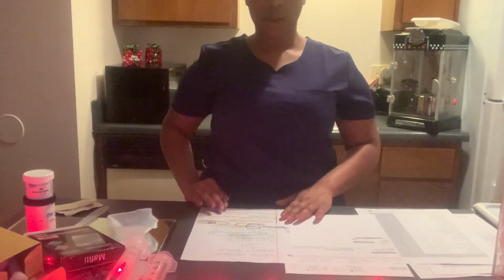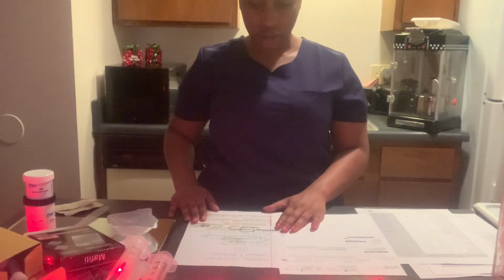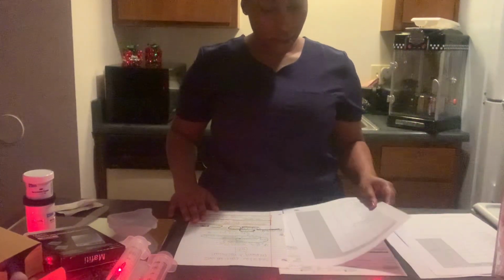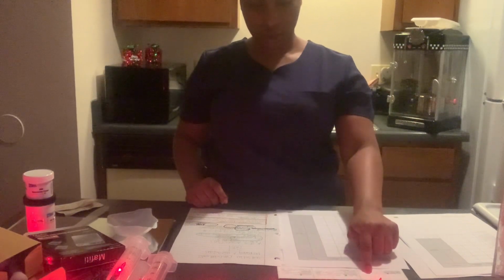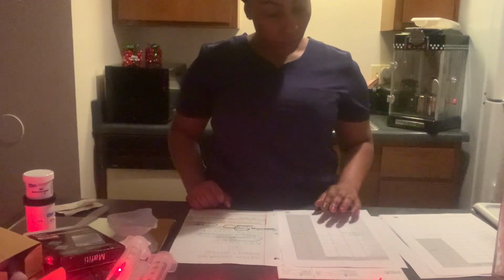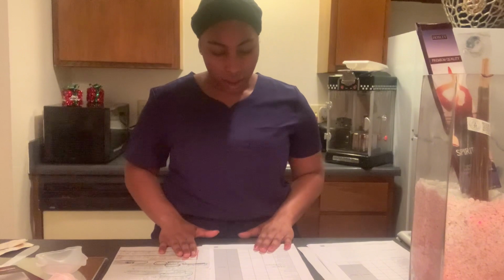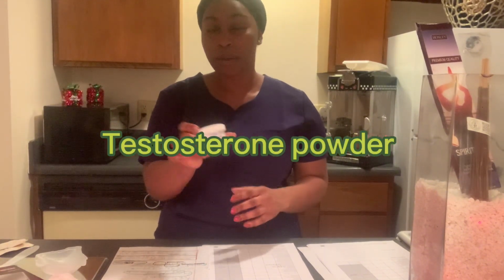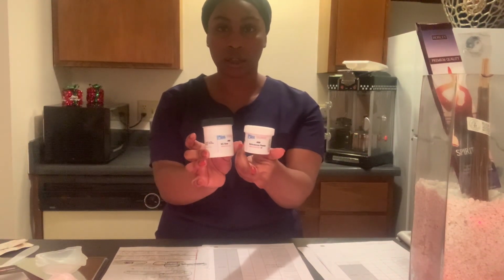The way that we will do our calculations to prepare a hazardous gel is that I have to look into our prescription first. Basically, what we need is our testosterone powder and then our gel base, which are the two that we're going to use to prepare the prescription.